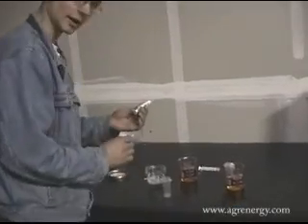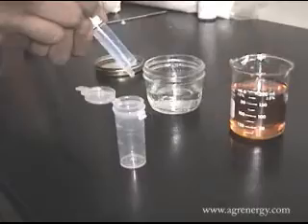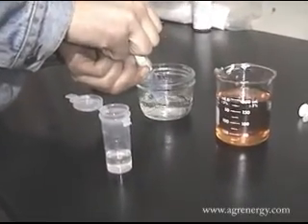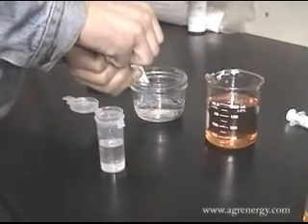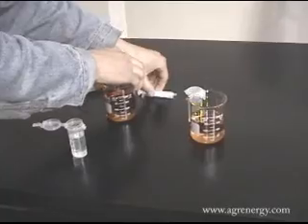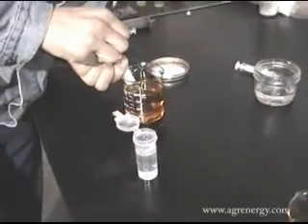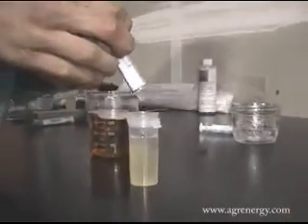So, we'll once again repeat this test. We'll first get our alcohol syringe, fill it up once, 10 milliliters, 20 milliliters, and 27 milliliters. Then we take our 3 milliliter sample of fuel and we put that in the sample of methanol.